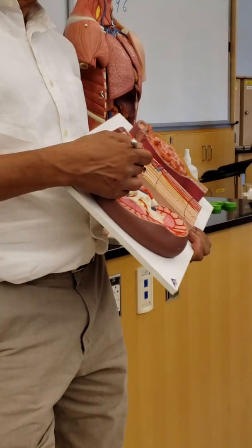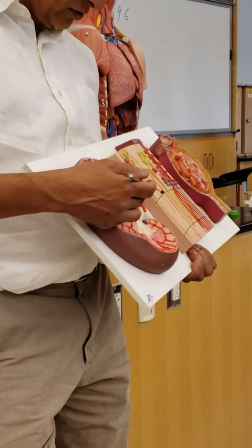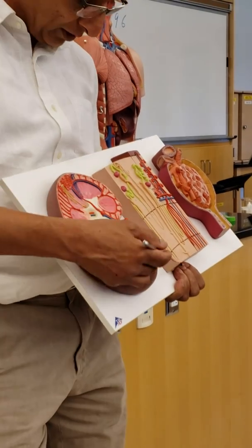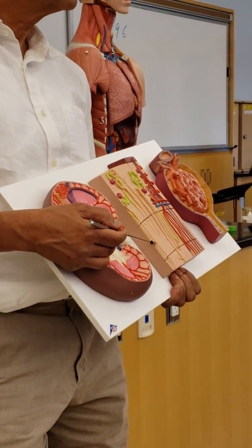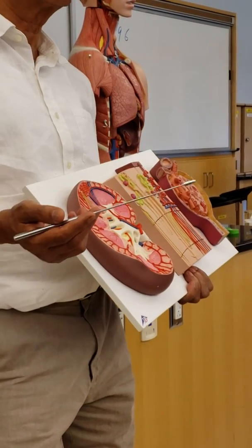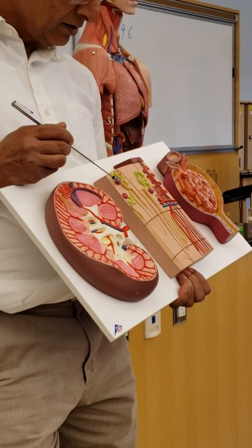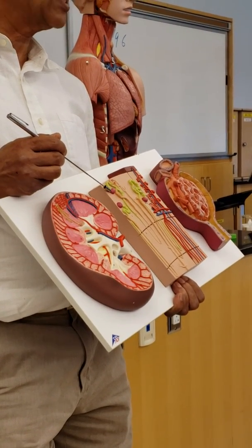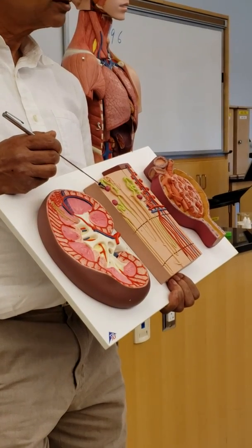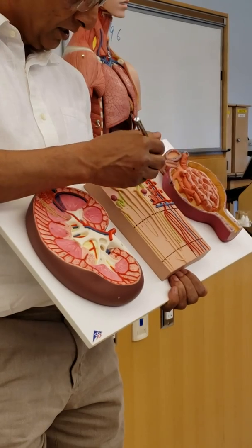This is cortical, is more towards the cortex, smaller loop of Henle. The one which is more in the medulla is called a juxtamedullary nephron. But anyway, both have the same parts. This part here, you can call it as Bowman's capsule. It's better called Bowman's capsule because it doesn't show. See, this is the detail here. Here, this is Bowman's cup.